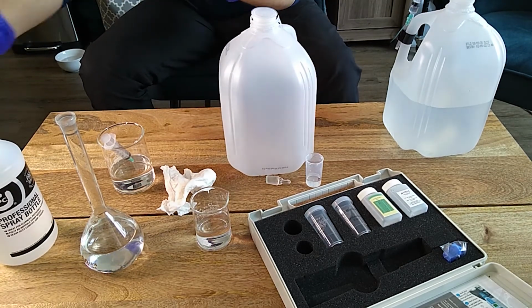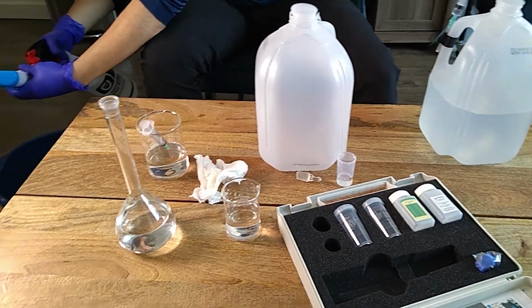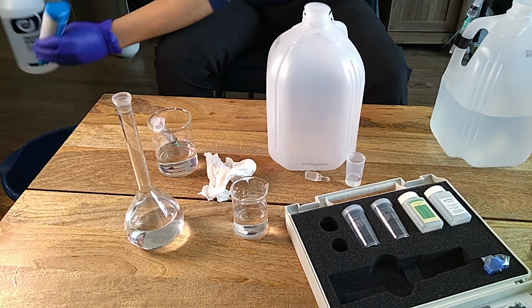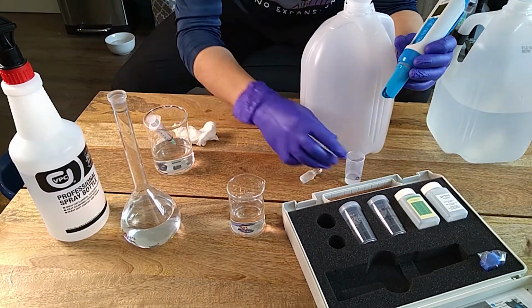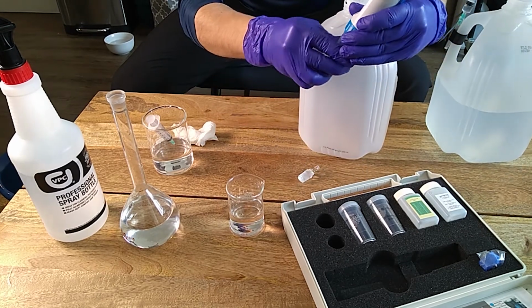Now I've turned this off and I'm gonna wash it with a little bit of distilled water and I'm going to just store this in distilled water.